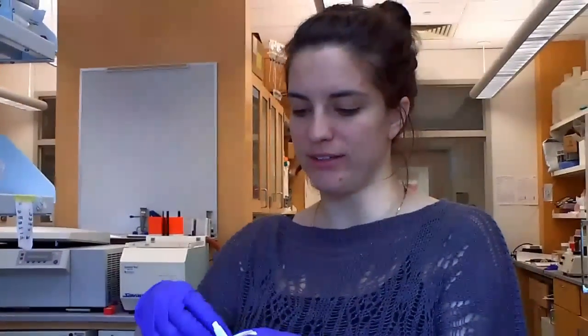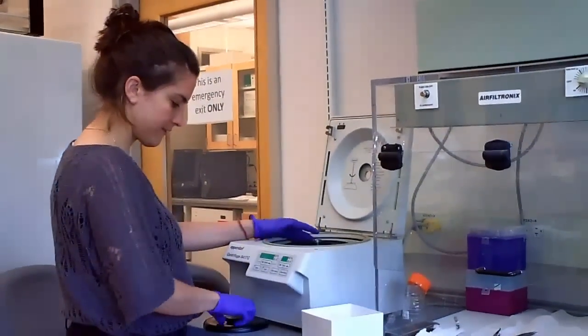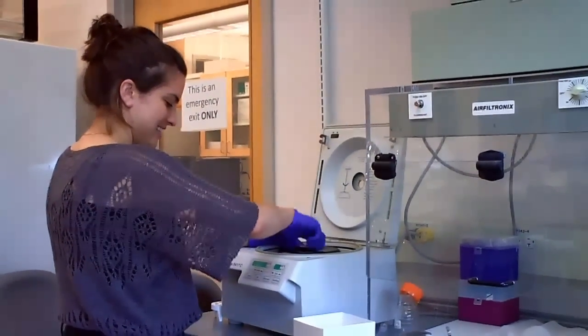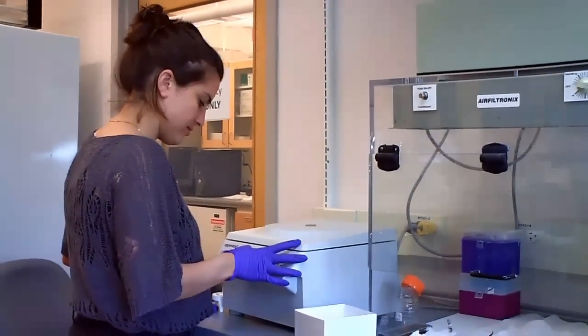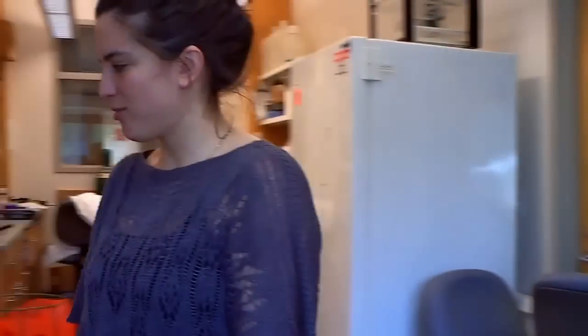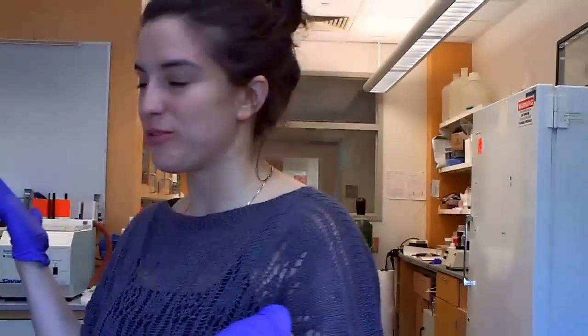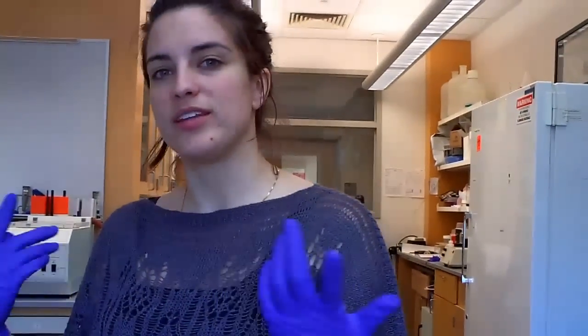Hi! It's been 40 minutes, and I went and got the transformations from the 40 degree incubator, and they look pretty much the same, so now I'm going to spin it down for a few minutes. And then we're going to plate those onto some leucine minus plates, because they have the gene for leucine plus, so it's a selection marker. And then we're going to let it grow for a few days.